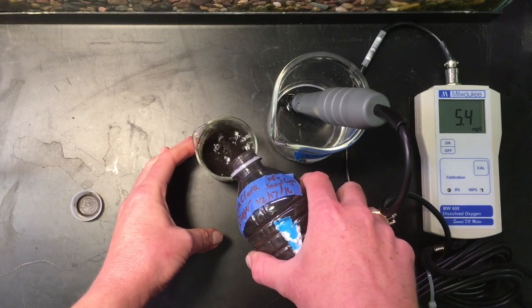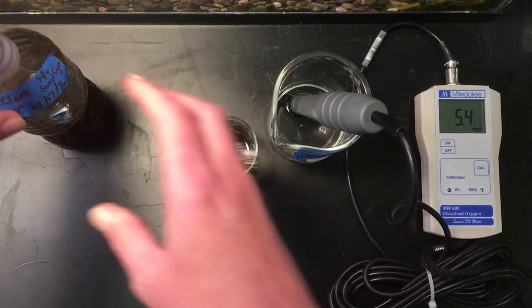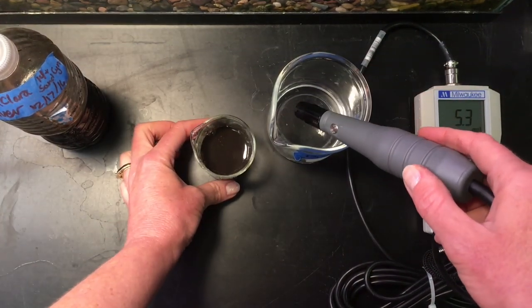Now as I pour, I do add a little bit of dissolved oxygen, or a little bit of oxygen to the water, but it isn't going to dramatically affect it.